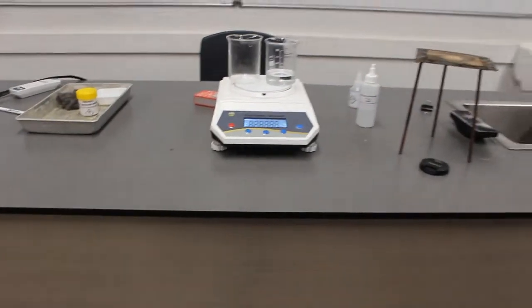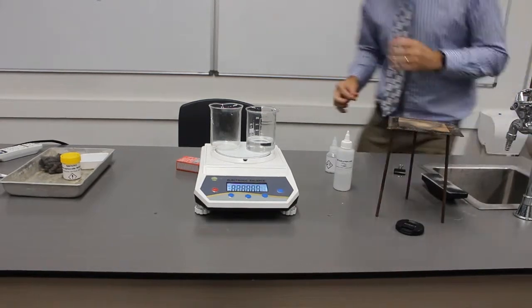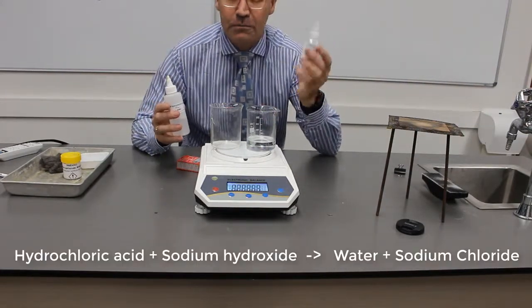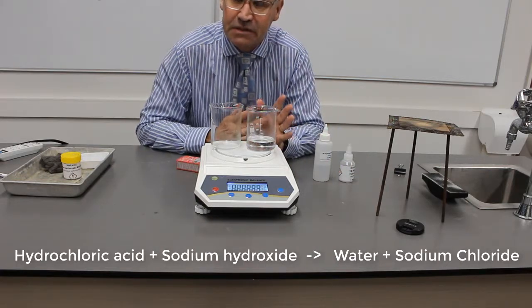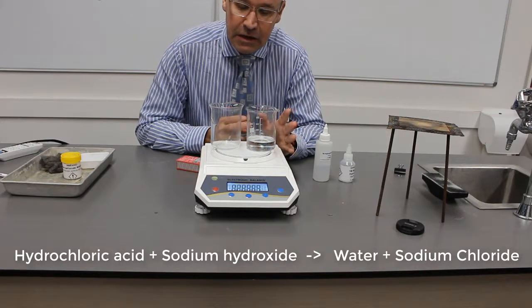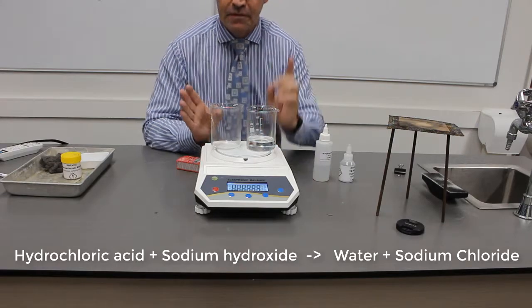So we have now got a new product here. Our product, we started with hydrochloric acid and sodium hydroxide. Now we have water and sodium chloride. So we've got new products, but the mass is the same.